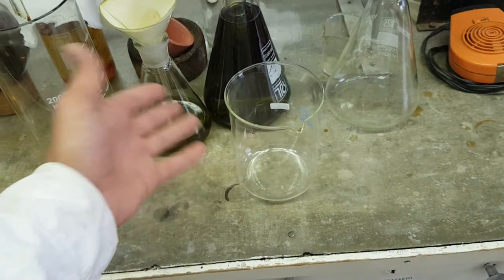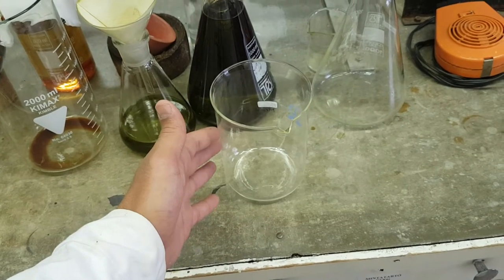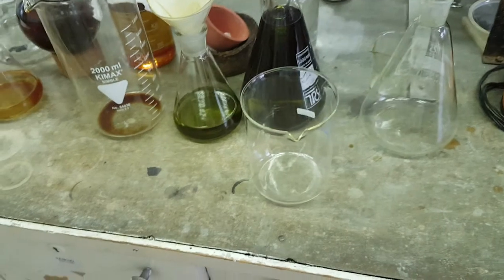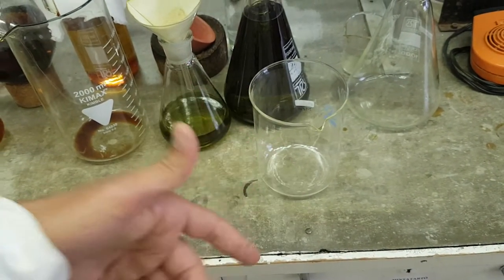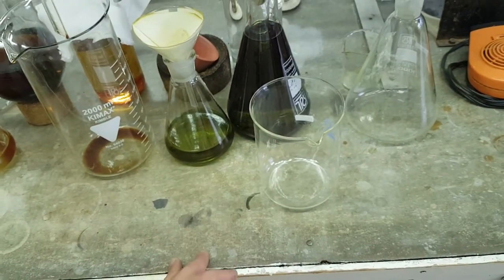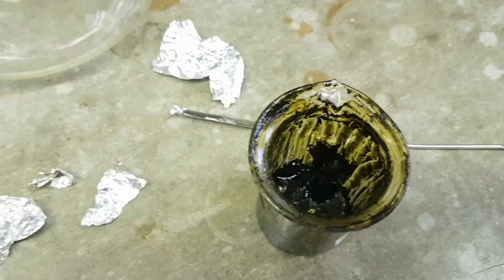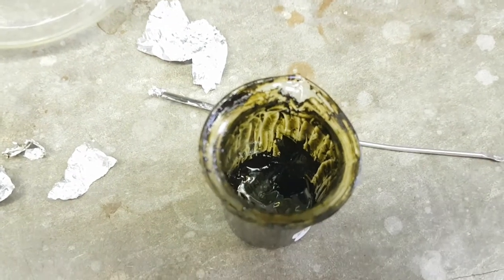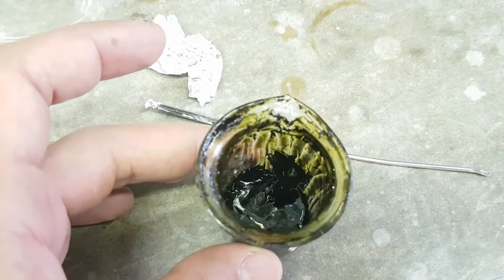It is better to avoid using temperature. After that, you will need to evaporate the methanol. Before using sonication, you have to repeat these steps subsequently in order to remove the color from the extract. Then, after obtaining the extract, this crude extract was prepared by methanol.